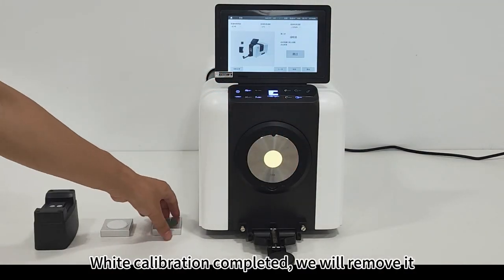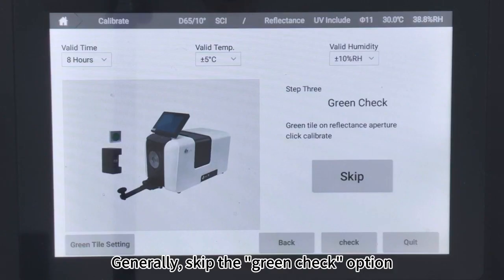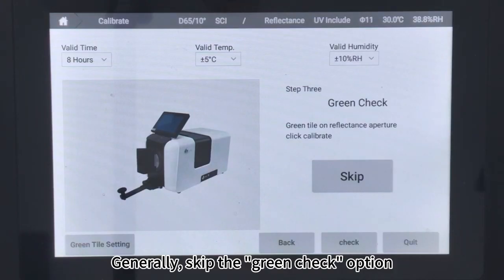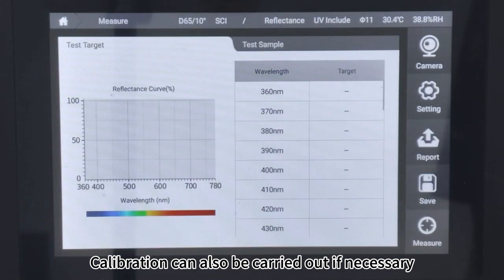Remove it. This is the green board. Generally, skip the green check option. Calibration can also be carried out if necessary.